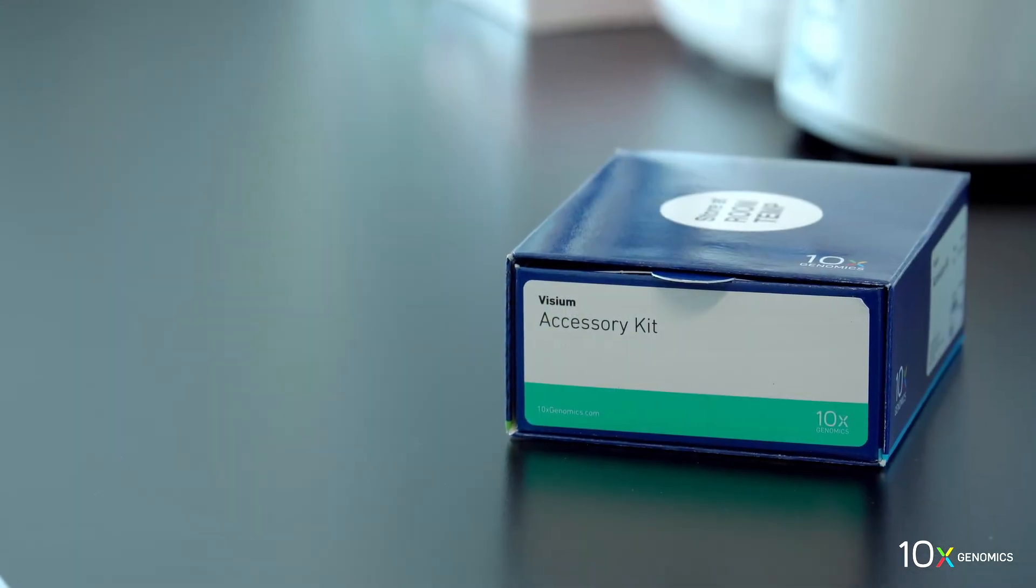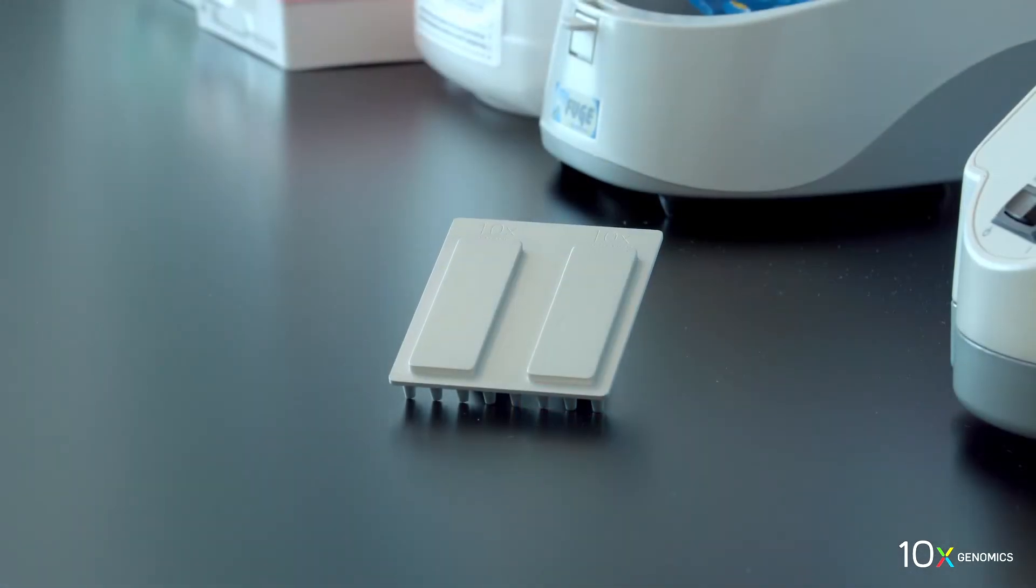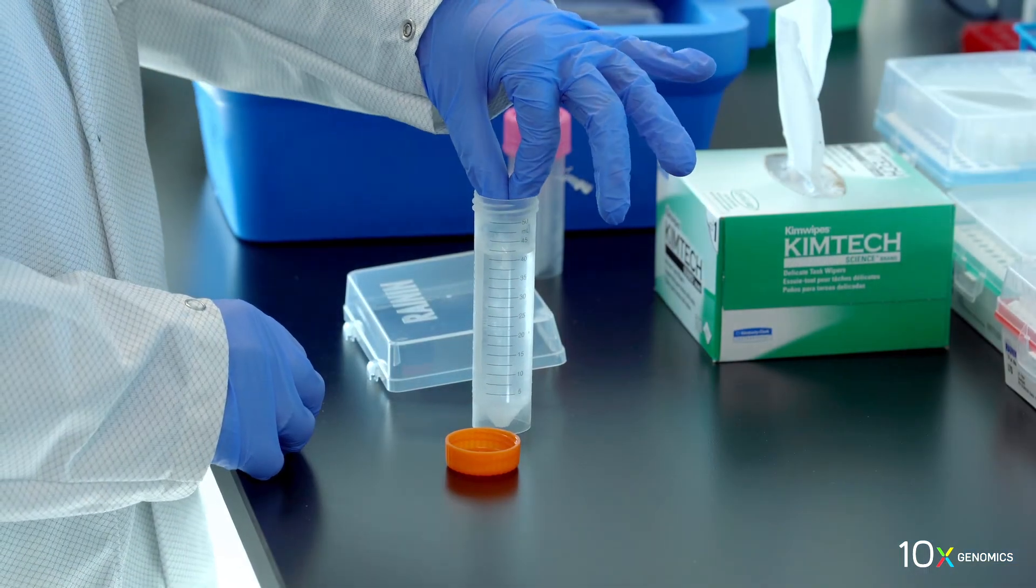The Visium Accessory Kit includes a Thermocycler Adapter and a Slide Alignment Tool. The Visium Spatial Tissue Optimization Kits are ready. Next, we'll fix the tissue.